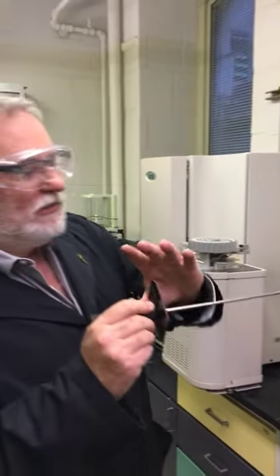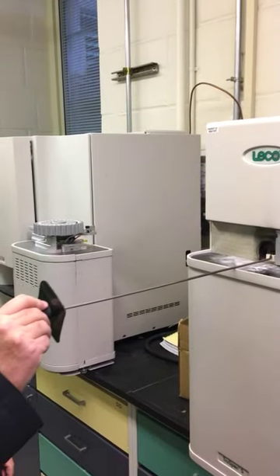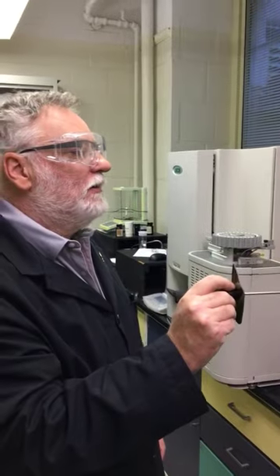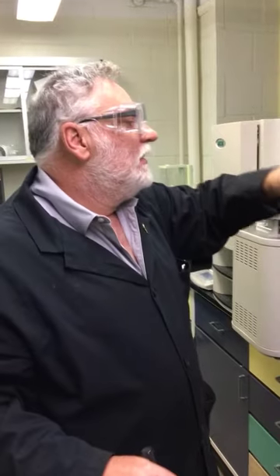And so we have a shield here that's going to help me push this boat in. As the ceramic boat goes into the furnace, I would look to see how far it's going. I would close the door. The gases are collected, sent over to the other instruments where infrared analysis will do an integration over the time period of the emissions to work out how much sulfur dioxide is in there.